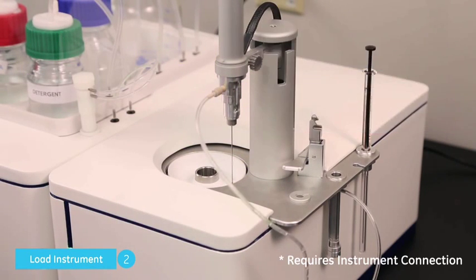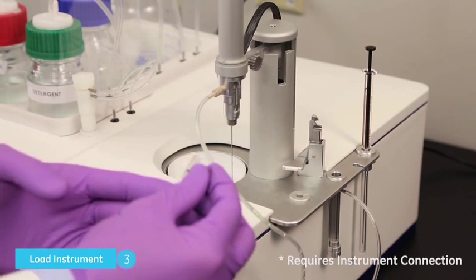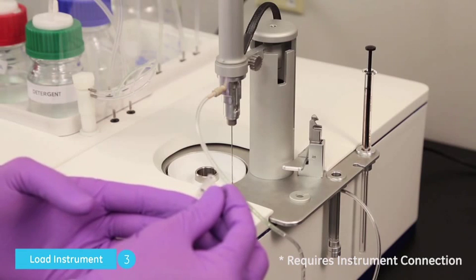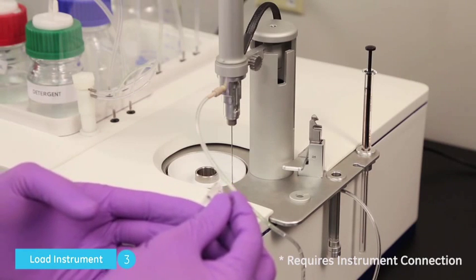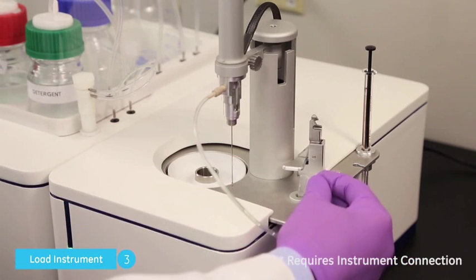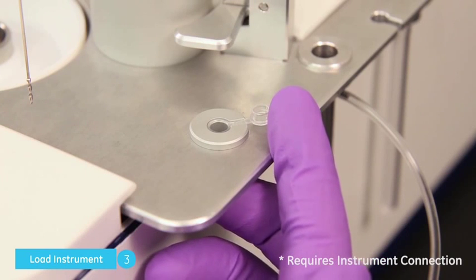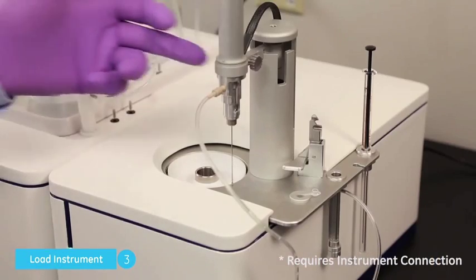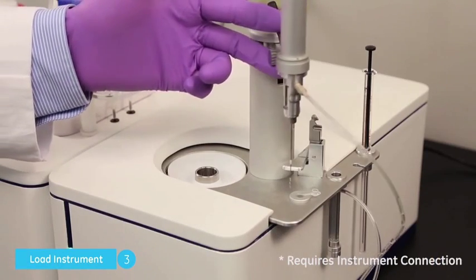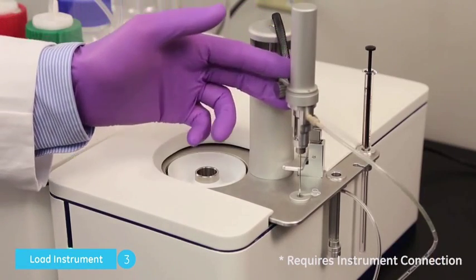The instrument is now moving the plunger down in preparation for loading sample. Load about 60 microliters of titrant solution into one of the supplied PCR tubes. Ensure the PCR tube has its lid properly situated in the key to load location. Now you may move the pipette to the load location.